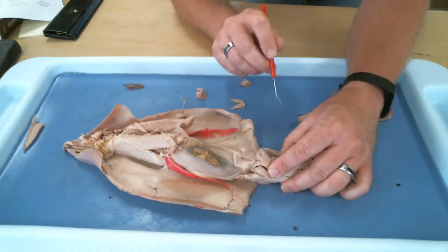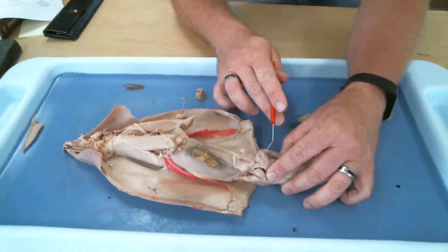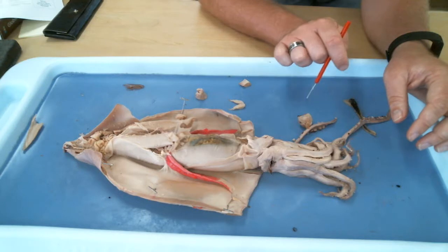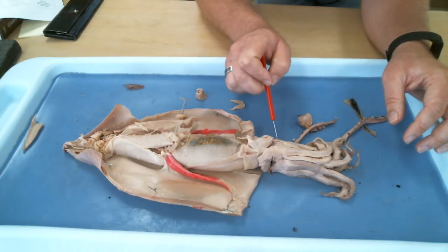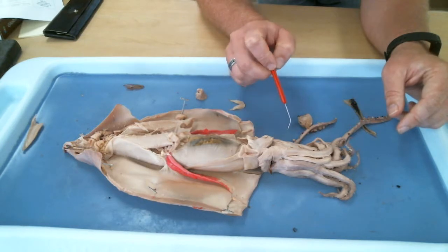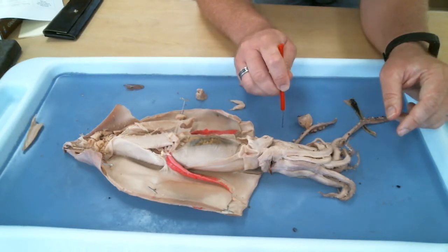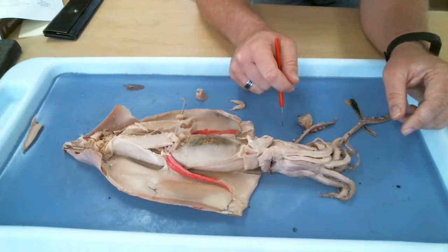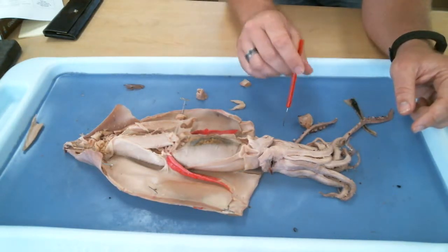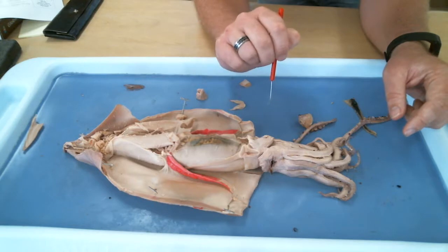This is not a giant Pacific squid. This is a more normal sized squid. But what did I tell you about the colossal squid? What did I tell you about their eyes? Biggest eye in the world. Largest eye in creation. Biggest eye that there has ever been. Bigger than elephants, bigger than blue whales. The largest eye that there's ever been. So that's kind of cool.